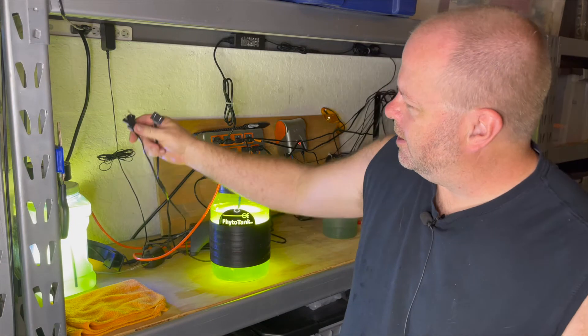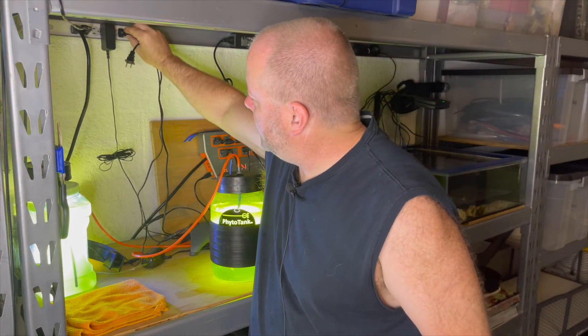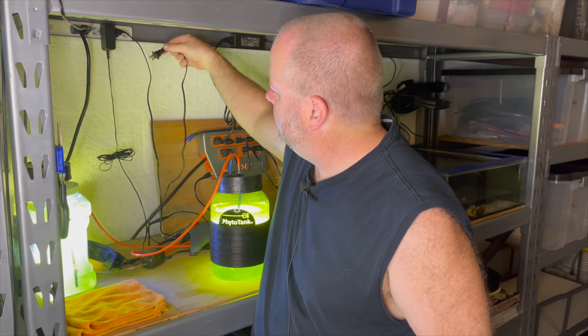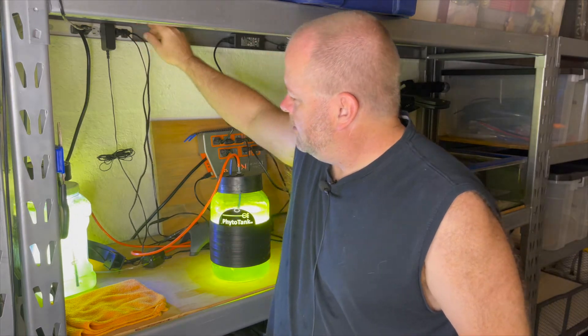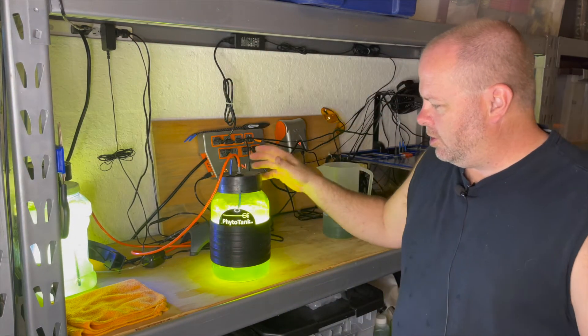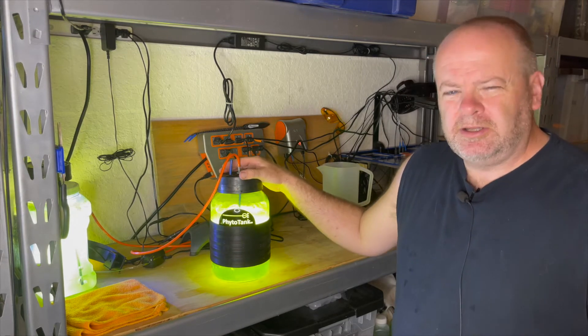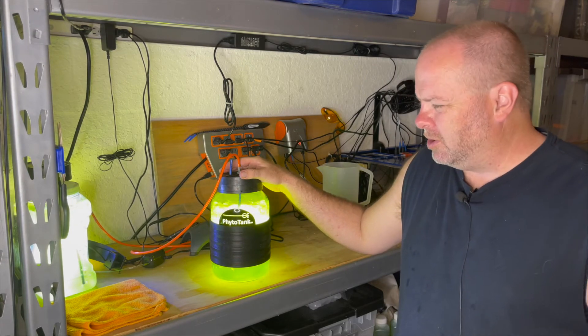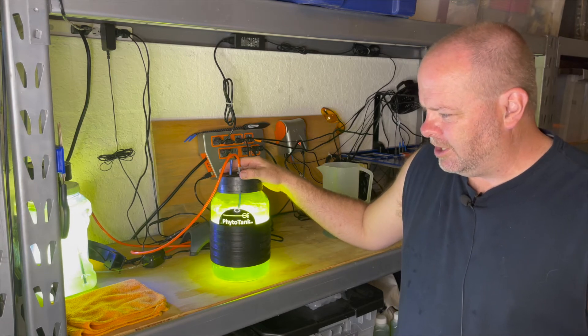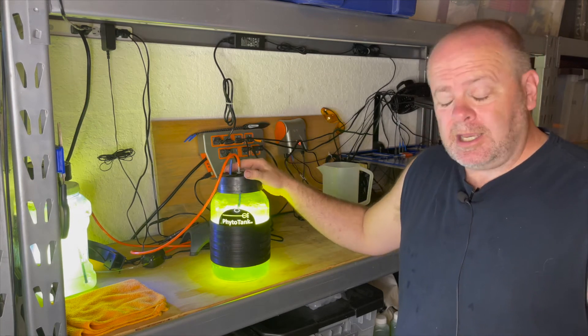And then what I'm going to do is I'm going to take my two air pumps and I'm going to plug them back in because you want to make sure that the water is kind of bubbling. I like to have it churning like this. That might be a little too high. It might be a little too low. I don't know. It seems to work for me. I get a good culture from it. And I think it works really well.